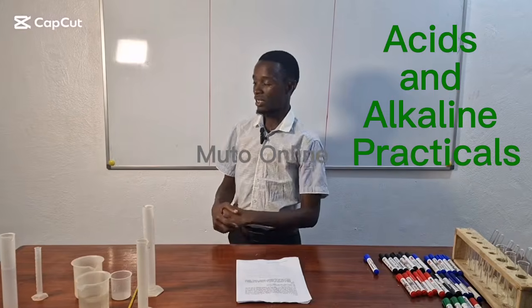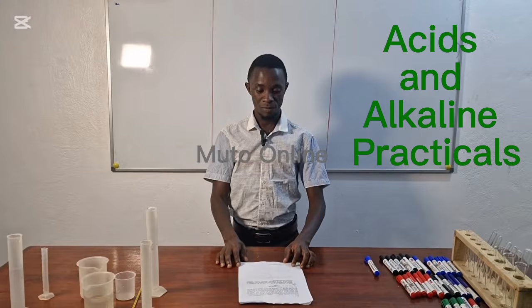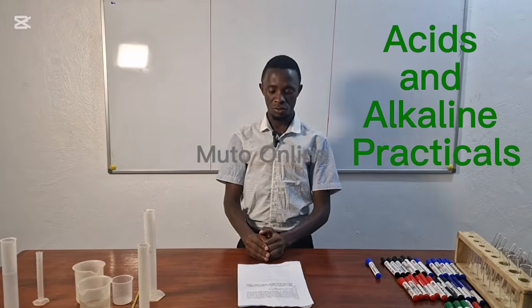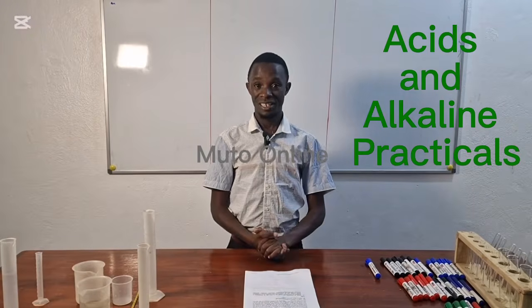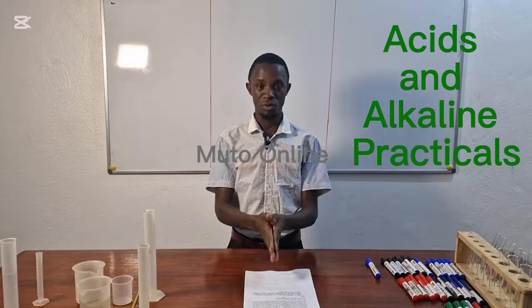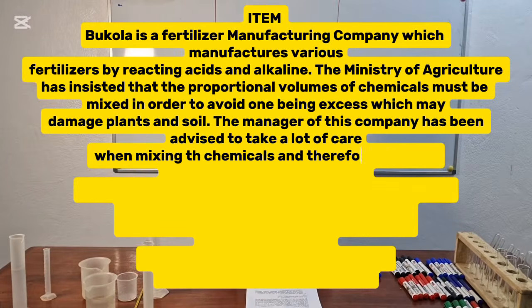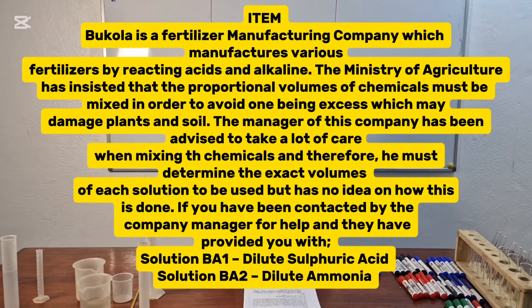I'm right here to take you through chemistry practical. We are going to do a practical that is actually common but rarely taught. We have here a simple question that we are going to go through, and the question is very simple, like we shall confirm at the end.